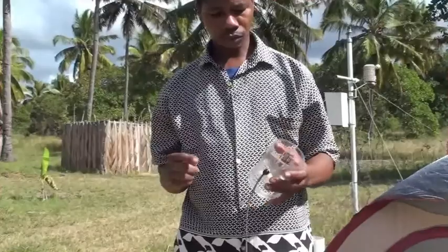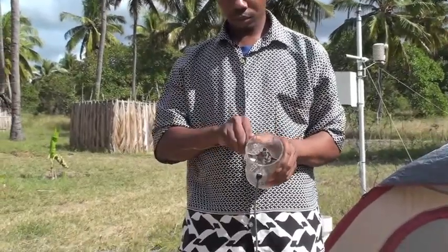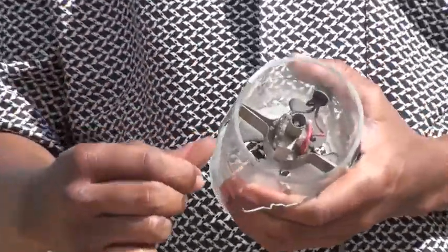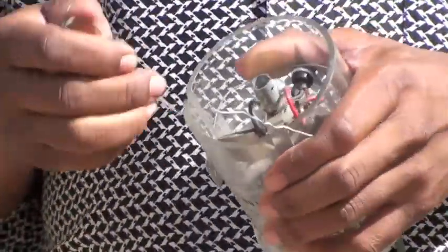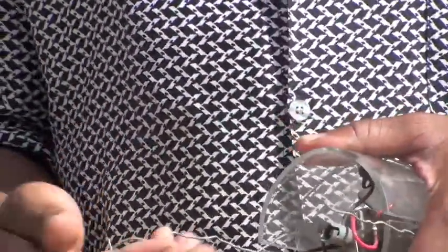What you do is to put the wire around the body of the trap so that two pieces of wire are extending, and these are then bent over.